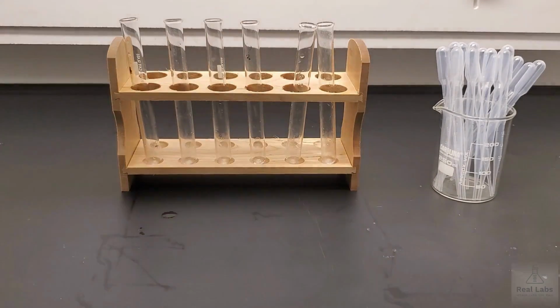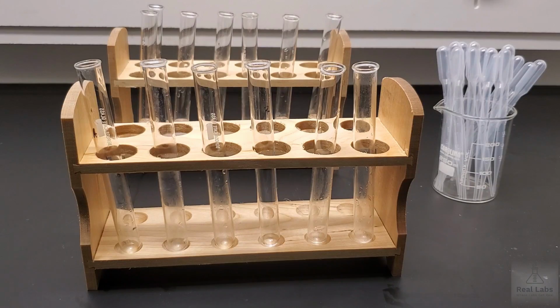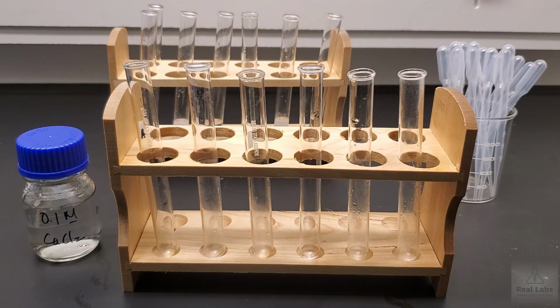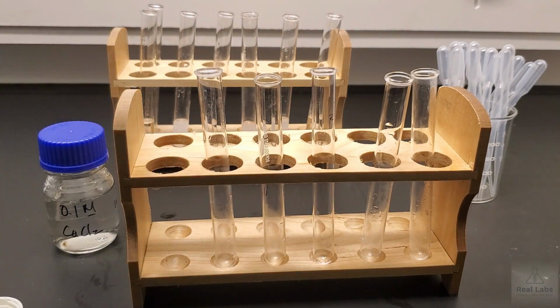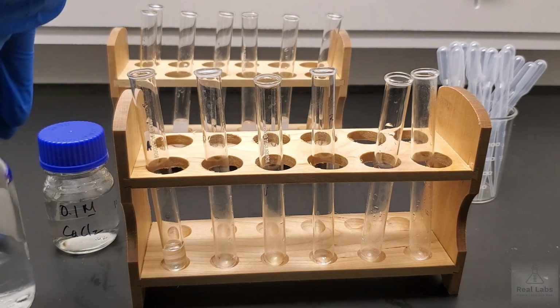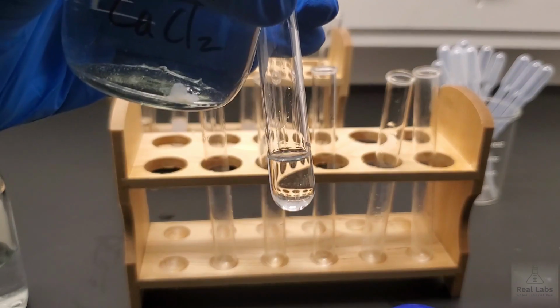We're going to move through to the 8th pair in this system. And we're going to mix 0.1 M sodium carbonate with 0.1 M calcium chloride. So there's our calcium chloride, and our sodium carbonate that we already used. They're both fairly dilute systems, so it doesn't really matter which way we add these. I'm going to add the sodium carbonate first since I already have that handy. Then we'll get a clean pipette. It's the first time we've used the calcium chloride.